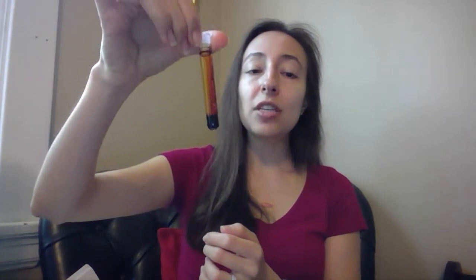Now for this experiment, we're going to be looking at starch specifically and the presence of starch in different food. So iodine, that deep reddish brown stain that you guys have in your lab kit, iodine can actually tell you if starch is present in a food or not, which is pretty neat. So it actually adheres to an amylose molecule, or a molecule that's in starch, to put it simply, and it will change colors, all right?